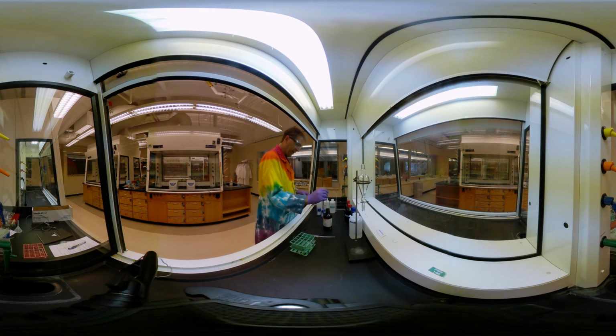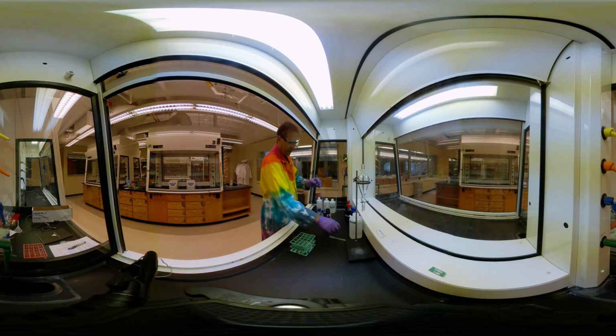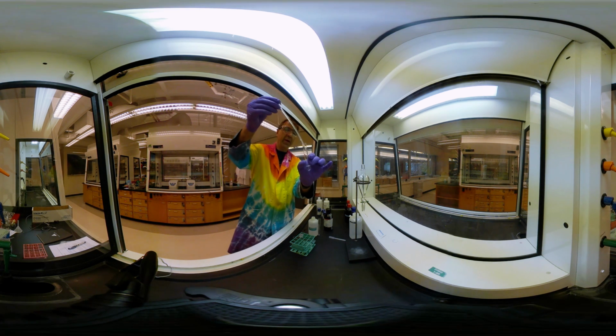Let me go ahead and put in my 2 milliliters of the hexanes. If you remember last time, that was my top layer, but let's check. Okay, sodium hydroxide. Make sure I've got gloves on, because sodium hydroxide is kind of nasty. And let's get this. This is 5%, about 1 molar. Let's go ahead and put that in there.